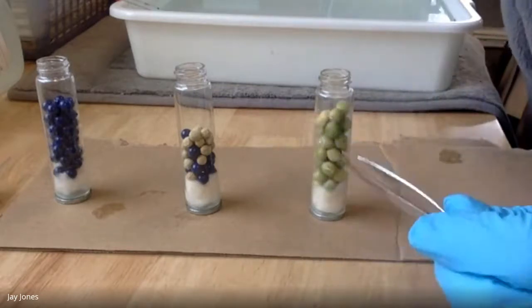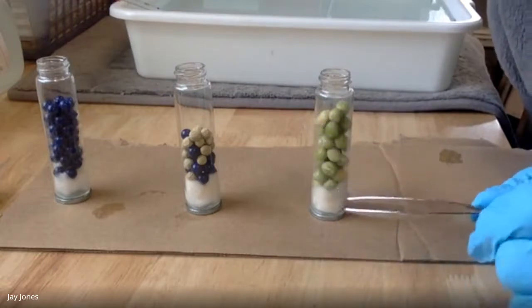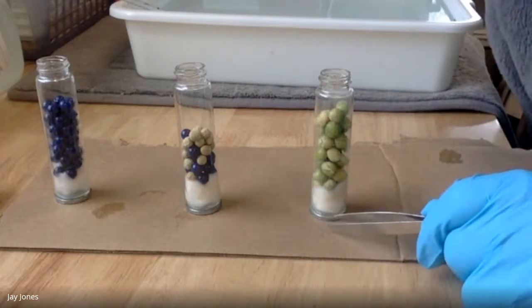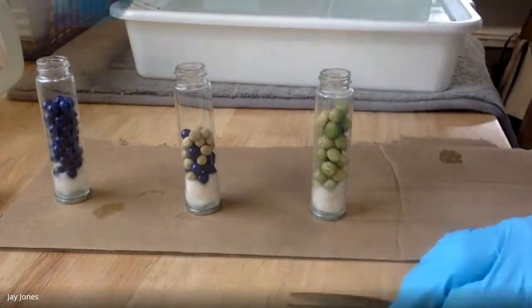But the point is, it's not so much the chemistry. The point is that we're grabbing the carbon dioxide that's made with the KOH. We're taking CO2 out as a variable. Okay.